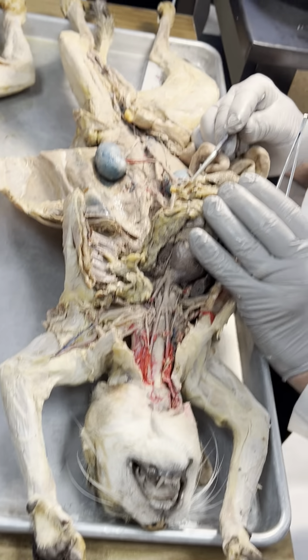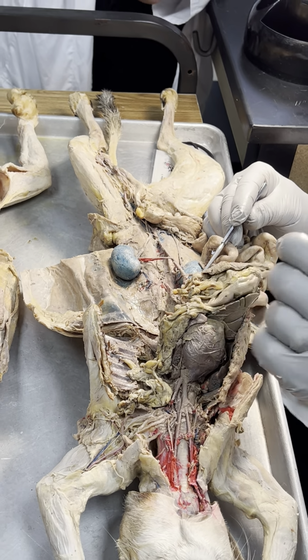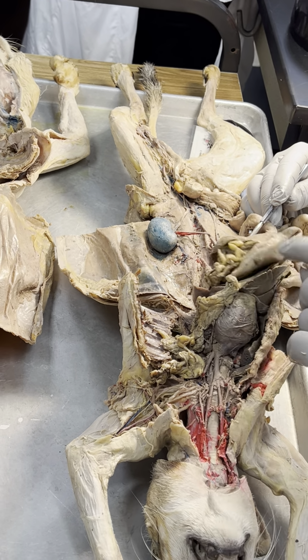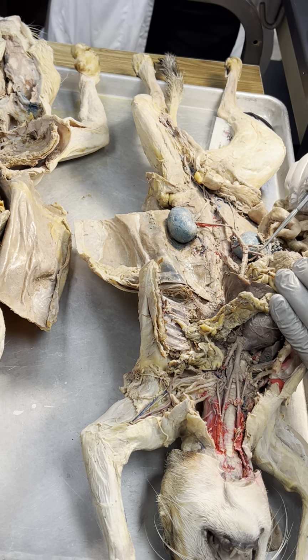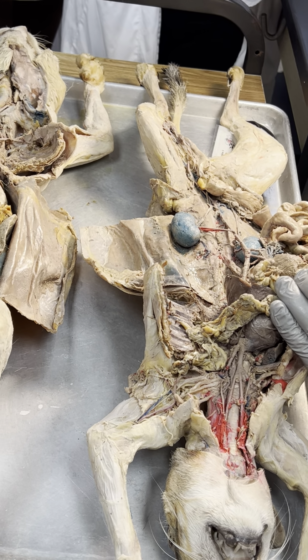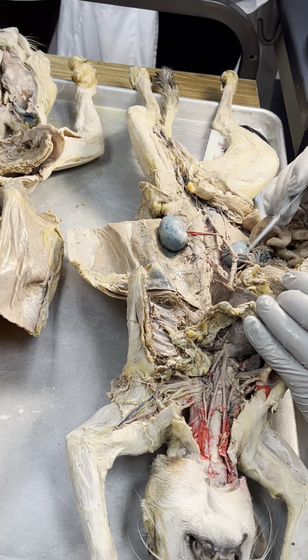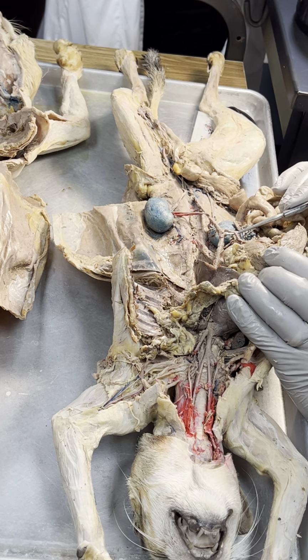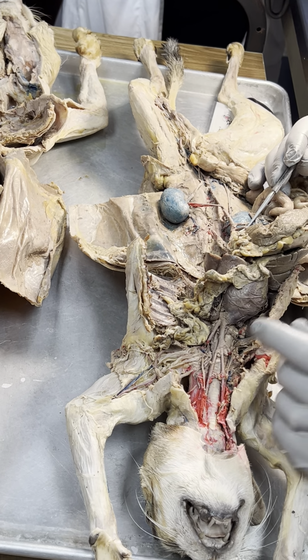What's this one? Celiac trunk. Why is that celiac trunk? Because there's the spleen, there's the stomach, it's going to the organs that are up here. That's why that's celiac trunk. And you just verified it, because that's the stomach, here's the spleen, the liver, the stomach sitting on top of the liver. You're gonna pin it like that? It'll look very similar to that, yes.